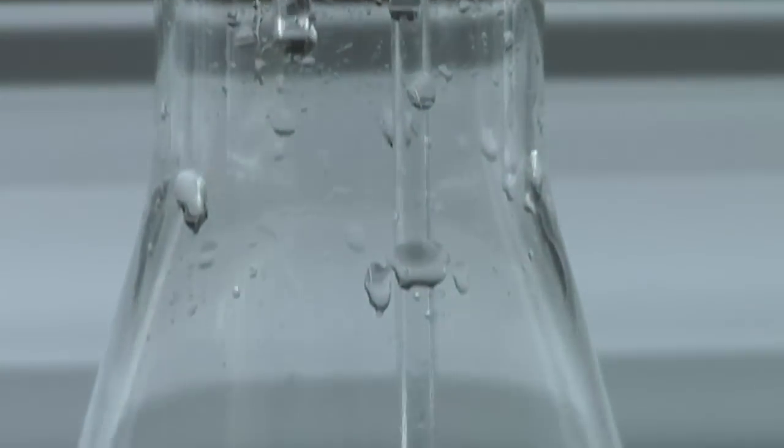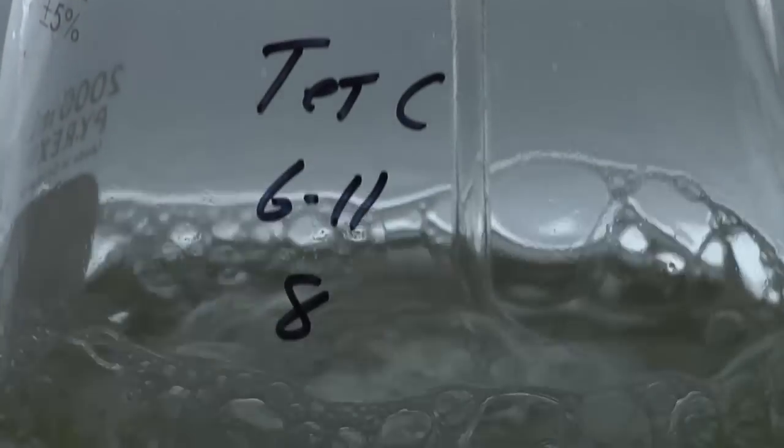The air that's bubbled into here is augmented with a little bit more carbon dioxide because plants need carbon dioxide to grow.